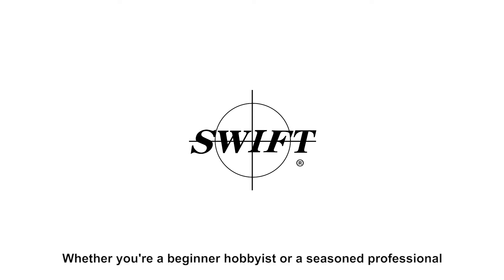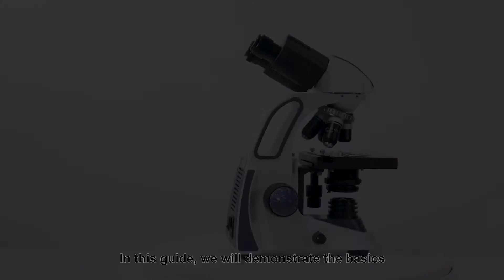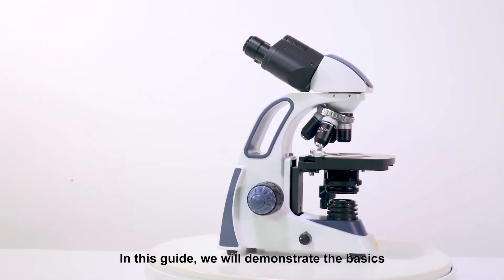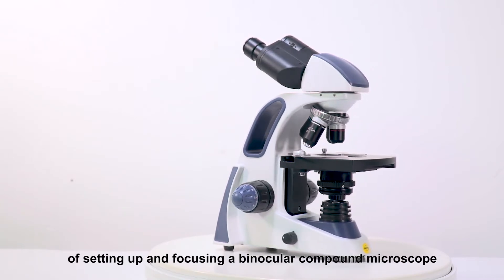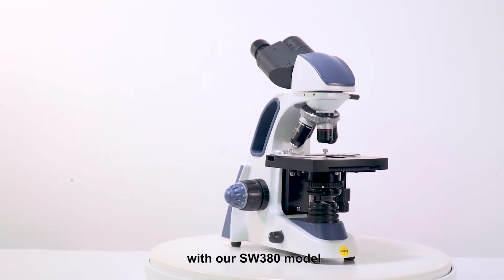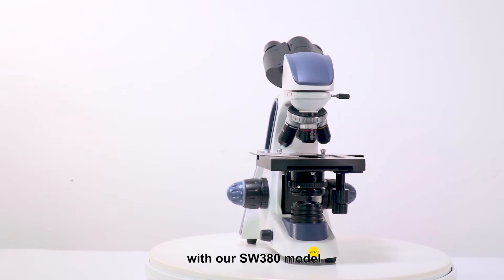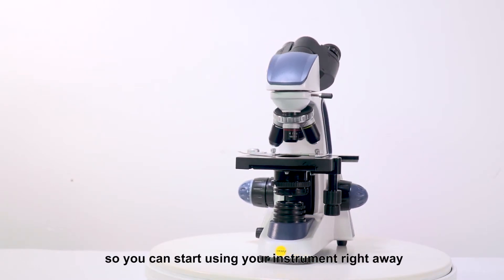Whether you're a beginner hobbyist or a seasoned professional, SWIFT has the perfect microscope for you. In this guide we will demonstrate the basics of setting up and focusing a binocular compound microscope with our SW380 model, so you can start using your instrument right away.